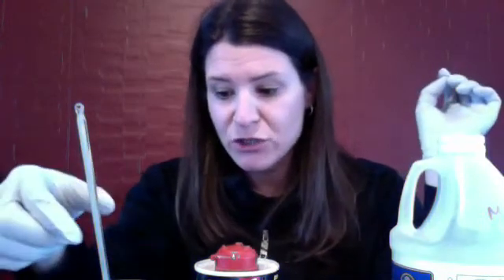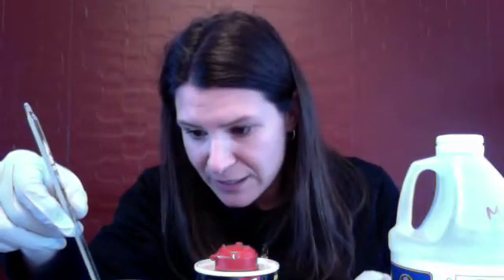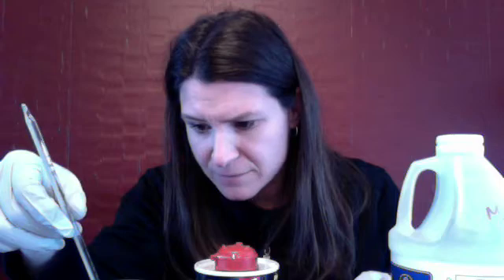And we're back. Hopefully you did what I asked you to do. Your initial temperature of the vinegar — we are using Celsius. Now it's gonna sound like my house is freezing but this actually came from the garage so we're using it as our initial temp. I'm reading it as clearly as I can — let's call that 12 degrees Celsius.